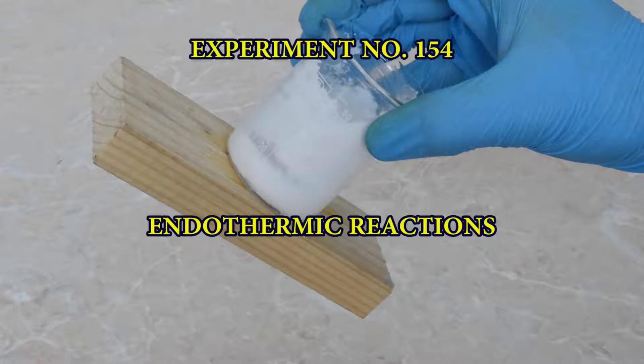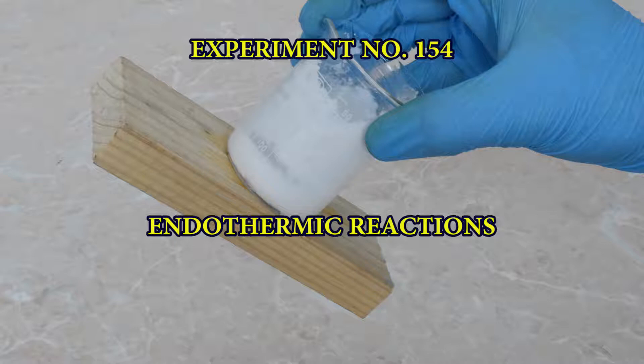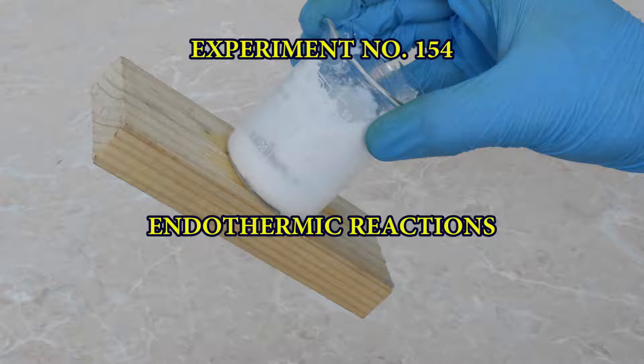Experiment No. 154: Endothermic Reactions. Most reactions are exothermic ones, as they are most likely to be produced. The reaction between barium hydroxide and ammonium chloride is performed in order to study endothermic reactions.